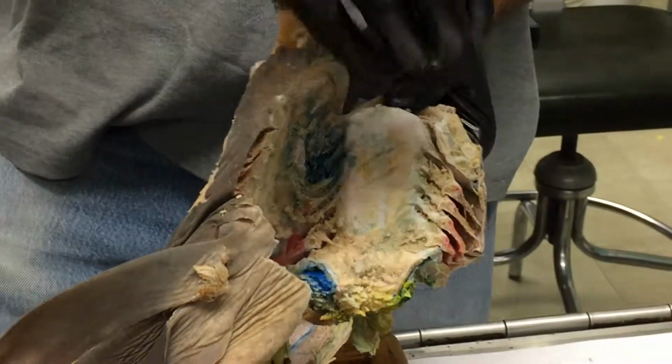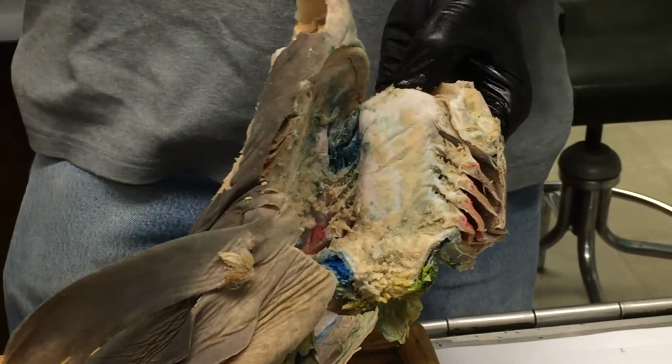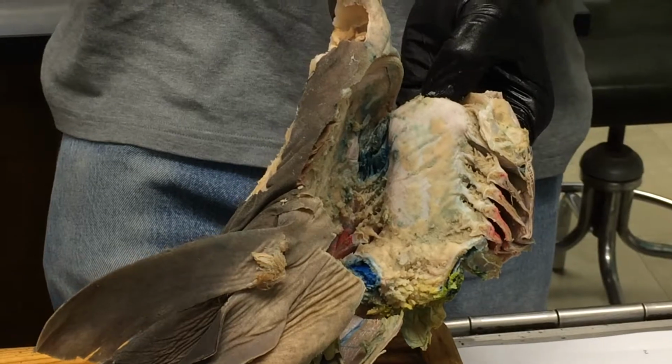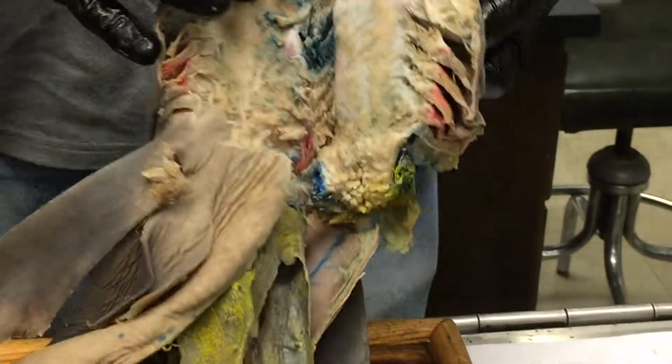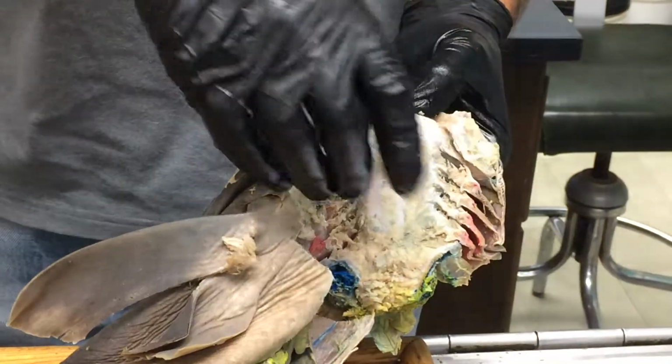And it's called a primary tongue because there's not a fleshy part that can move like with our tongue. And fish, that's what fishes have in general. It's a primary tongue. The secondary tongue, the fleshy tongue, develops in tetrapods. Okay. So you see that all right? Yeah. So it does sort of look like it has a tongue.